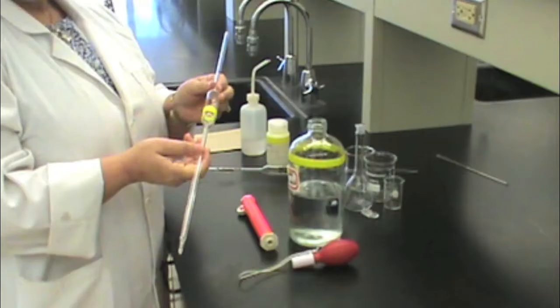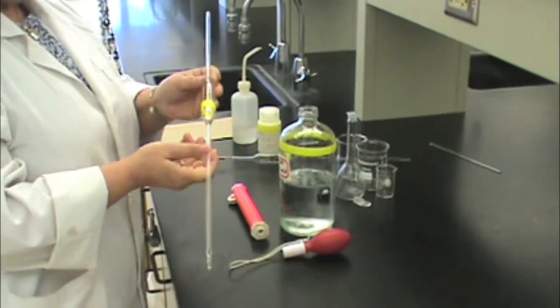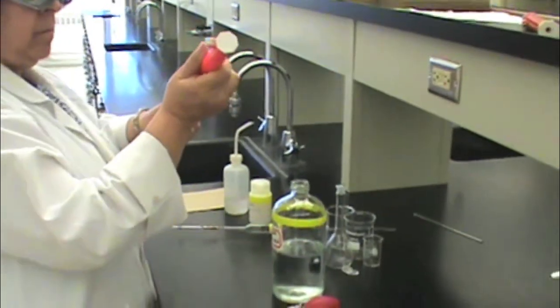In this video we will show you how to properly use a volumetric pipette. If you are using a pipette filler, take your volumetric pipette and place the pipette filler on top.